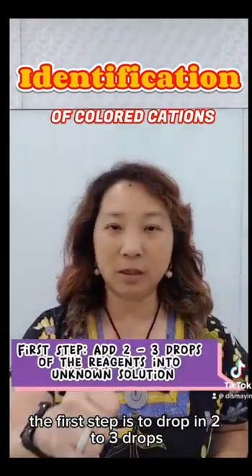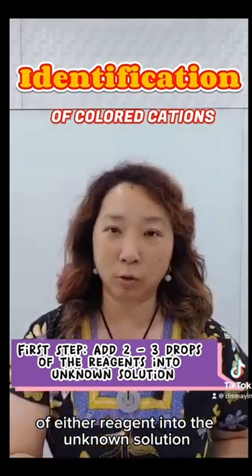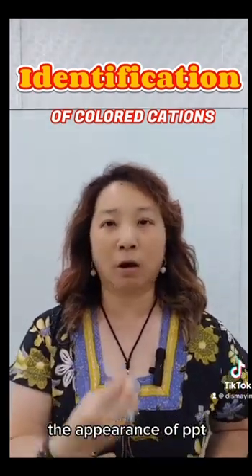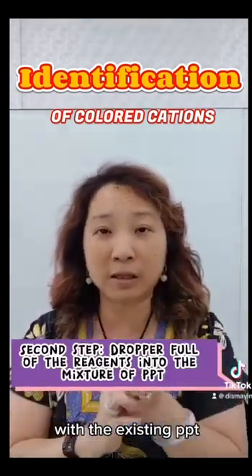The first step is to drop in 2 to 3 drops of either reagent into the unknown solution and observe. What you are looking for is actually the appearance of PPT. If the PPT should arise, then the color of the PPT. Step 2 is with the existing PPT.